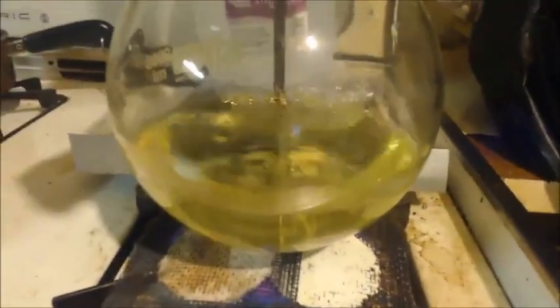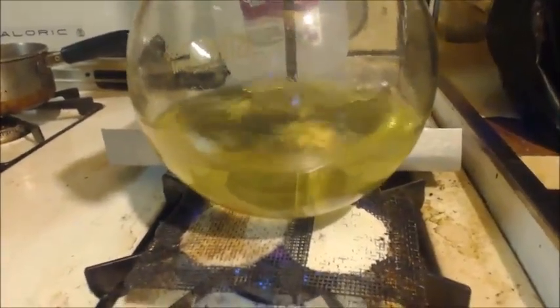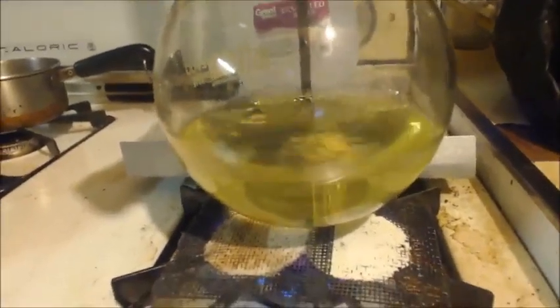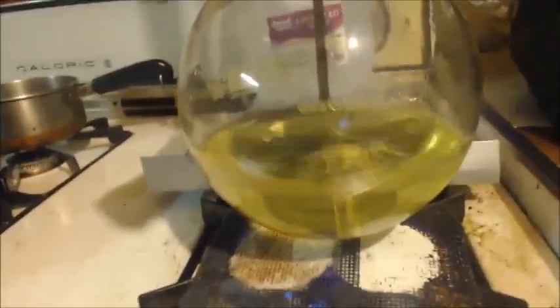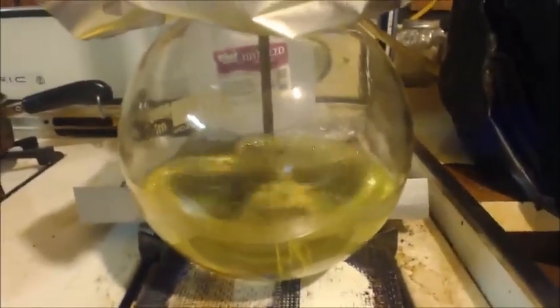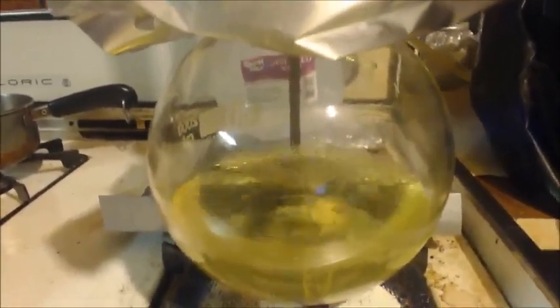I'm going to tell you what acid I'm making from xylene. Got some dilute nitric acid in there, some xylene, and I'm just cooking it up. And that's it. Oxidize one of the methyl groups to a carboxylic group, and then you'll have methylbenzoic acid, or some people call it toluic acid. Just like when you get benzoic acid and you get some sodium hydroxide and mix it together and dry distill it, you can do that with this, but instead of getting benzene, you'll get methylbenzene.